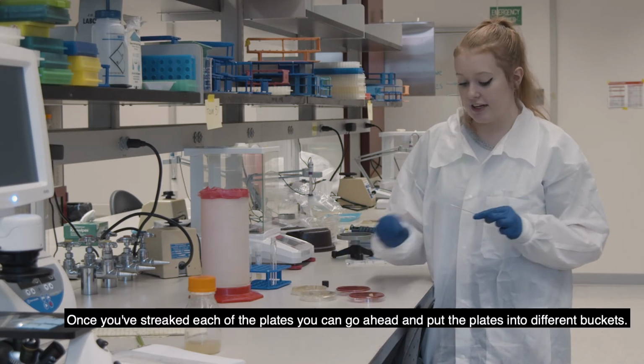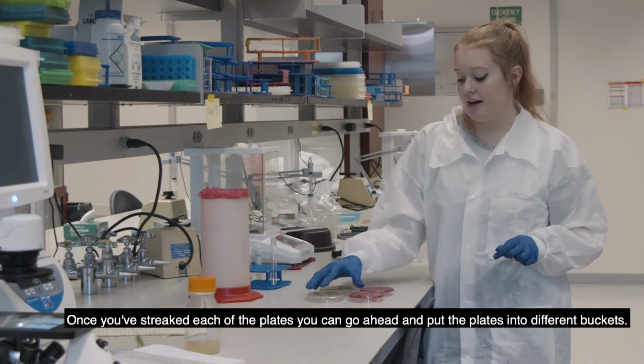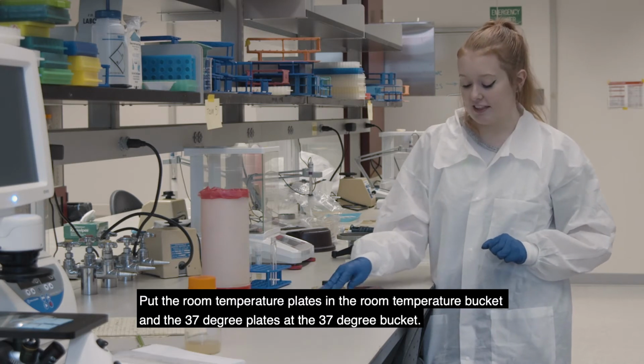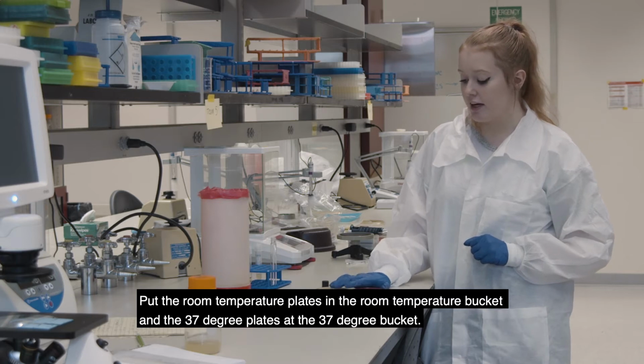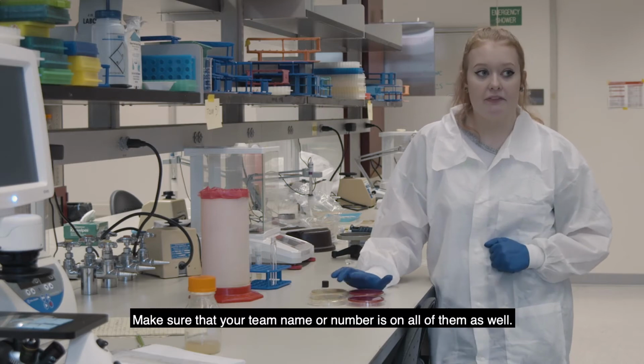Great, and then once you've streaked each of the plates, you can go ahead and put the plates in the different buckets. So you want to put the room temperature plates in the room temperature bucket and the 37 degree plates in the 37 degree bucket, and make sure that your team name or number is on all of them as well.